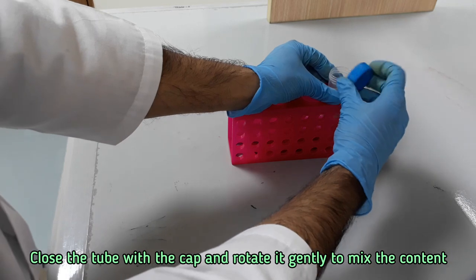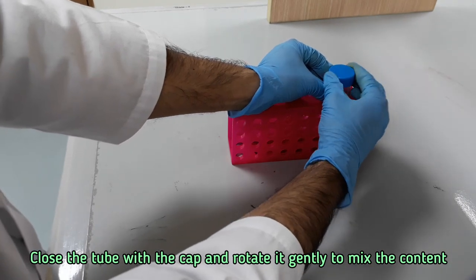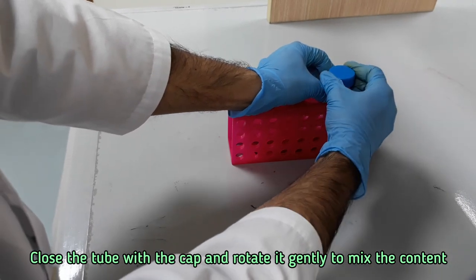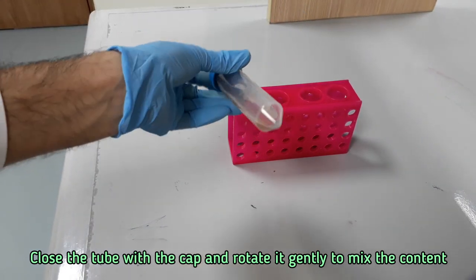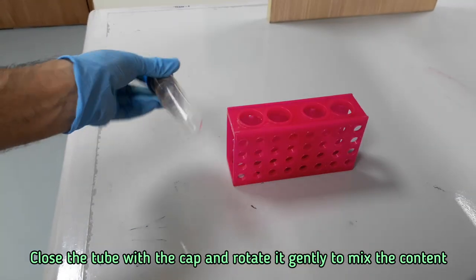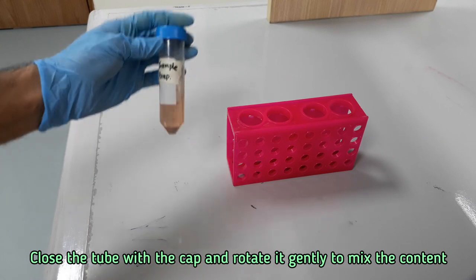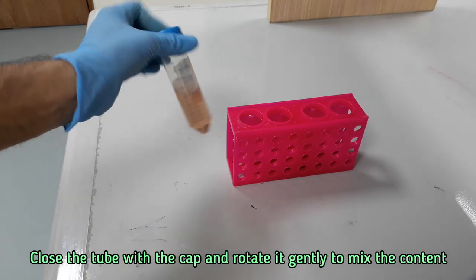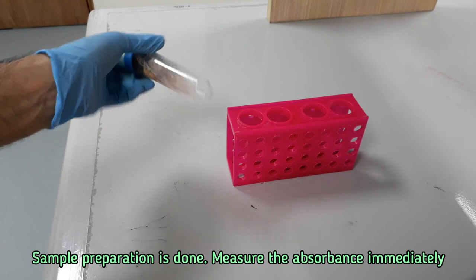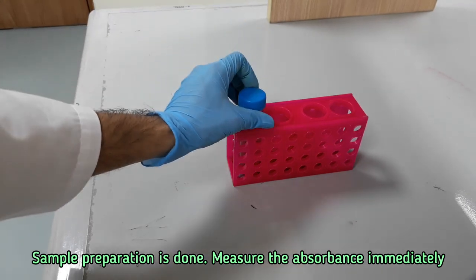Close the tube with the cap and rotate it gently to mix the content. The sample preparation is done. Now take the prepared sample immediately to measure the absorbance.